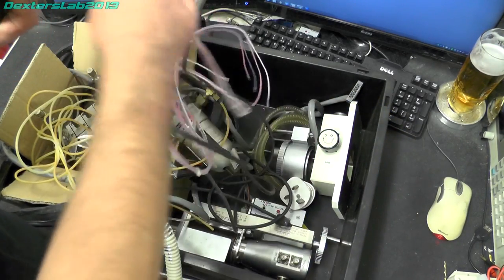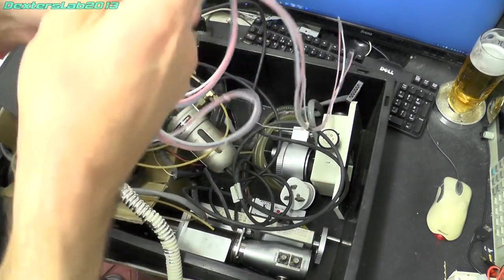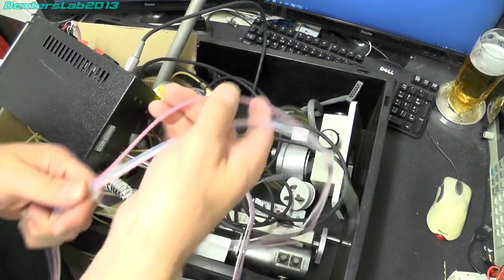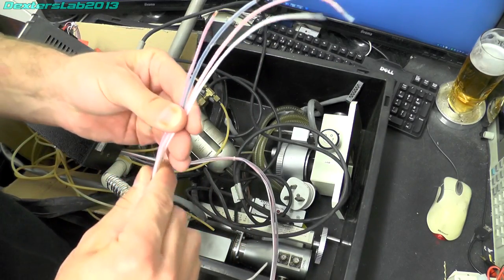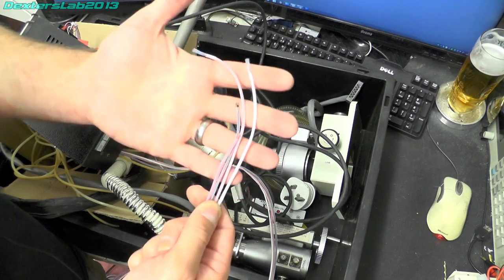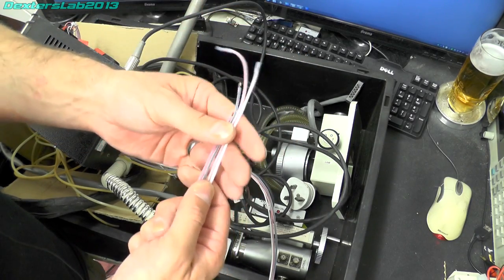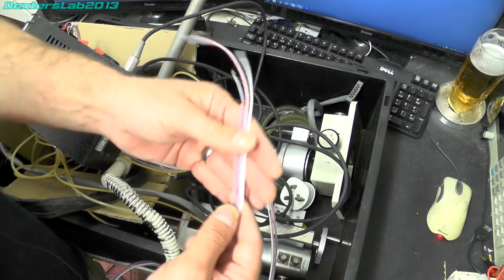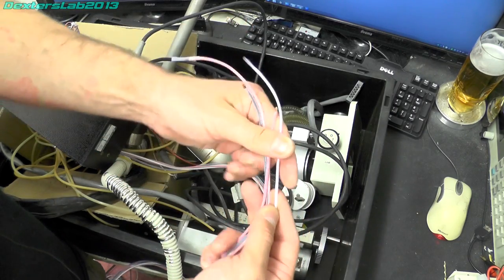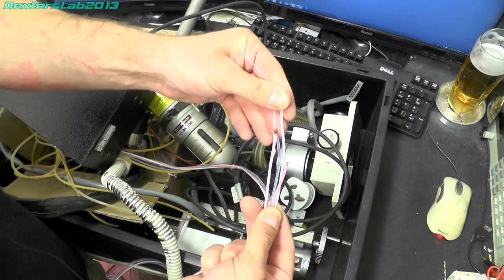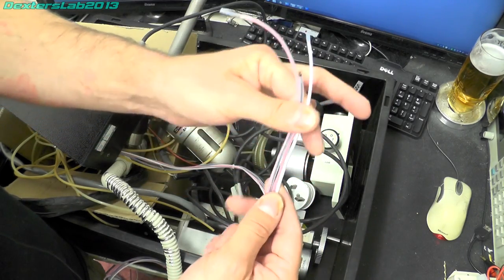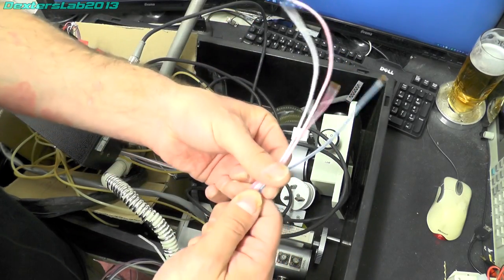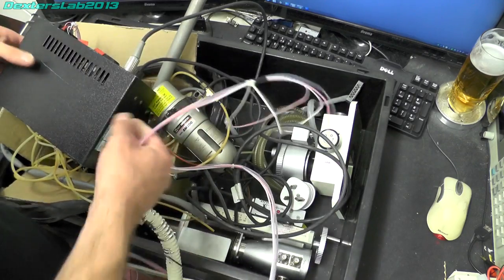These particular wires here were fed into a large Anelva baffle which was located just above the main baffle on the diffusion pump and I believe it's filled with liquid nitrogen. These wires were shoved into one of the holes and if you look they're all actually slightly different lengths.